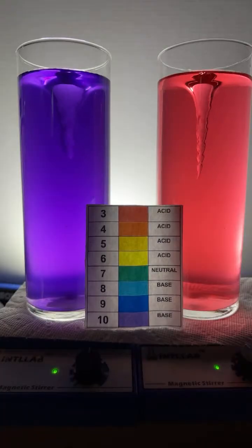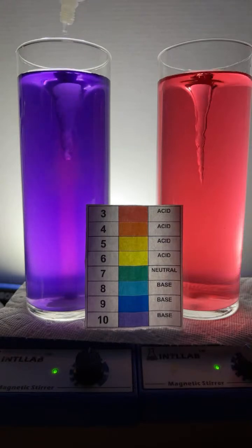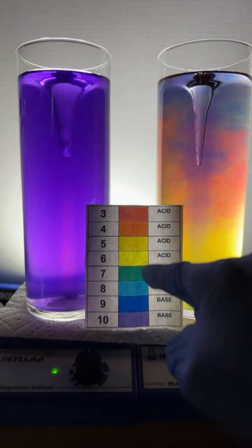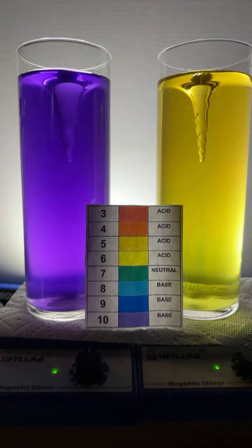I don't know there, Aiden. I have no idea. Let's start adding some acid now, hydrochloric acid. Make it orange, says Ducky. That's a tough one. We're going to try. Ducky, yellow's not so hard. So I'm going to add to this red one over here. I'm going to add some base, and that'll make the pH go up a little bit. There's your yellow.